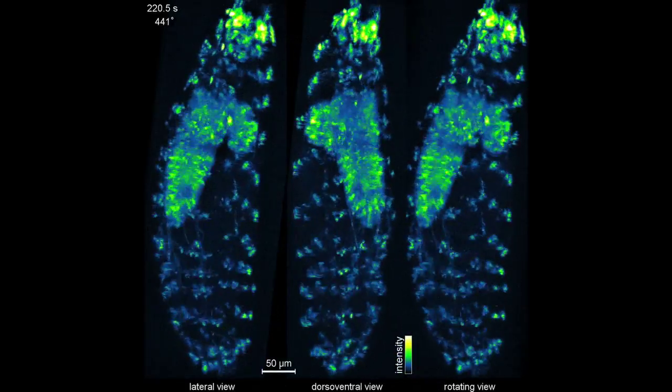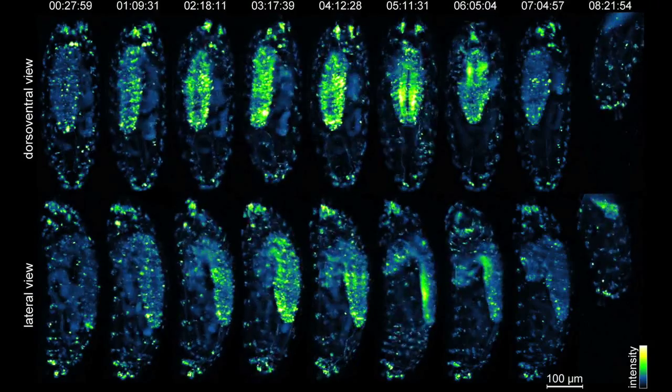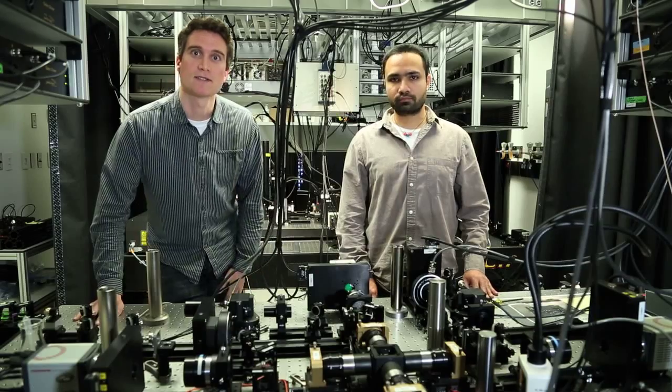So now for the first time with this microscope, we can track cells through a developing embryo even in fairly deep regions of the specimen. We can do whole animal functional imaging in many relevant biological model systems. And so we're excited to take advantage of this capability.